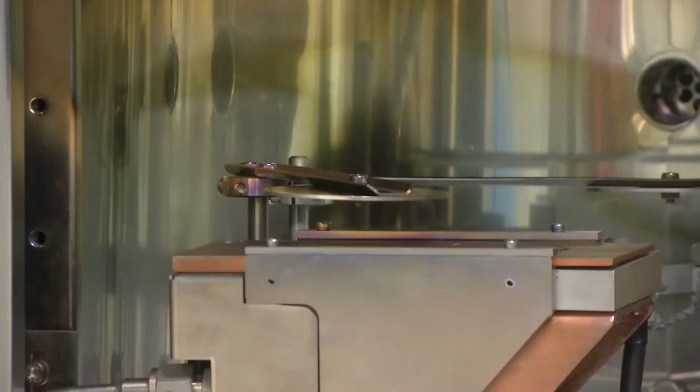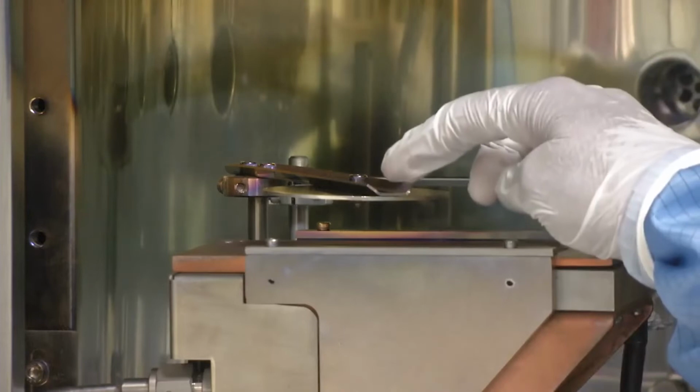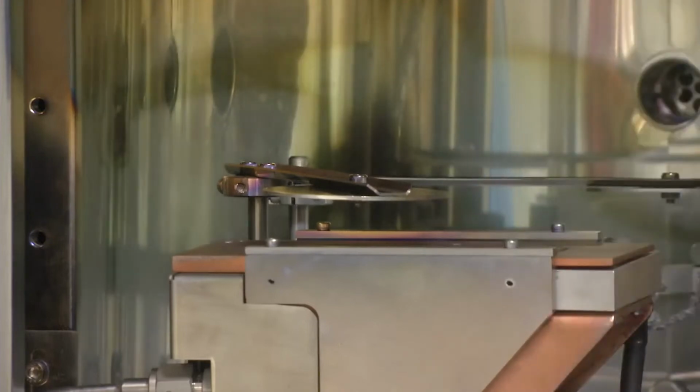Another important part of the vacuum chamber of an electron beam evaporator is the shutter. The metal shutter plays a very important role in preventing any kind of deposition onto the substrate unless desired. Until an optimum beam current is falling on the material held by the crucible and it is totally melted, we do not want any deposition to start on our substrate, such as a silicon wafer or glass wafer, because if it happens, it may lead to non-uniformity in the deposited film.